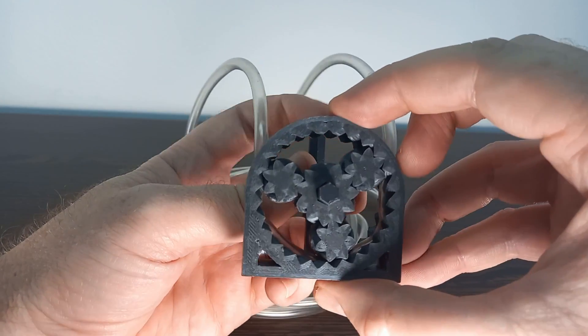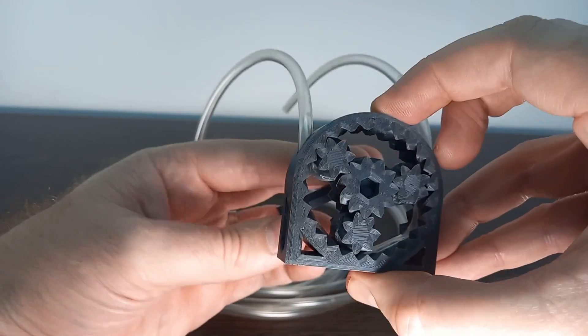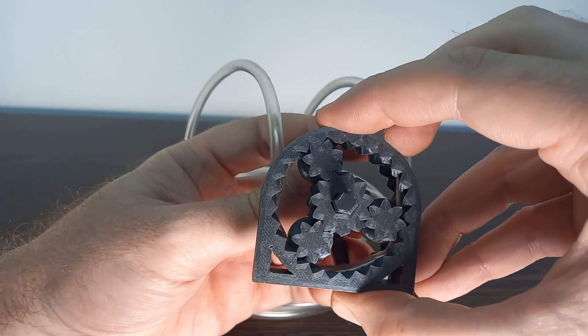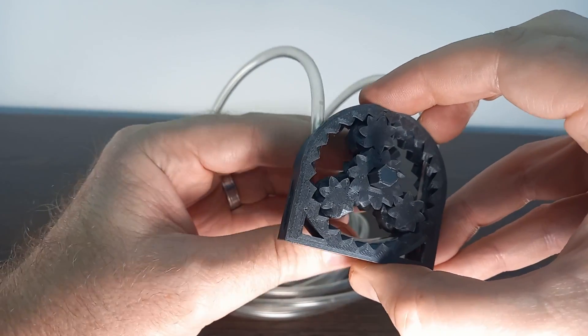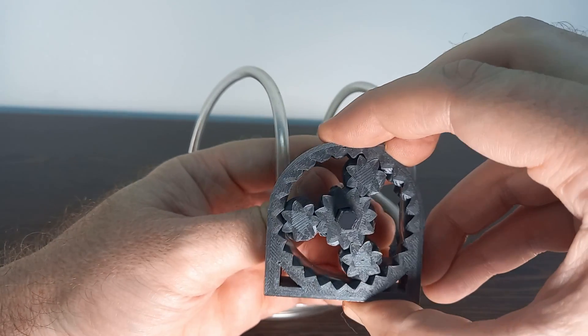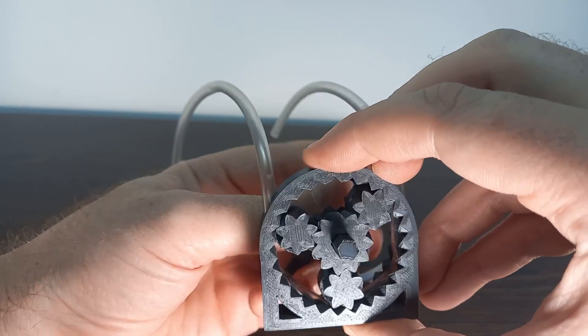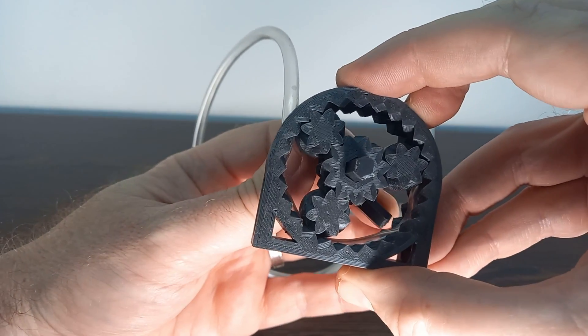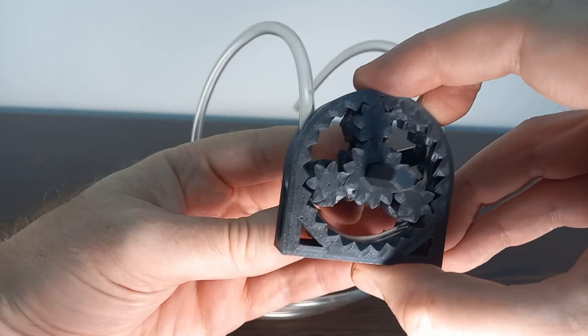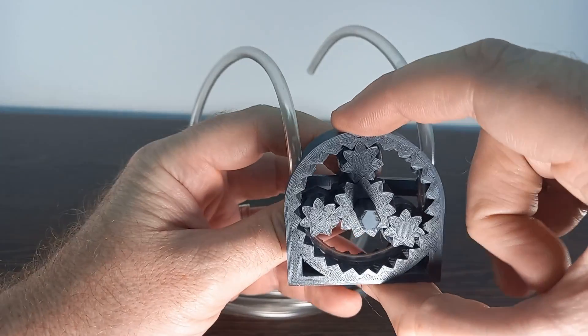Unfortunately, the tubing that I've got here is far too tight. I need some softer tubing, so this one does not work at the moment. But I'm sure if we had some better tubing, I'd be able to get this in properly and turn this around so that we could actually get water to pump.